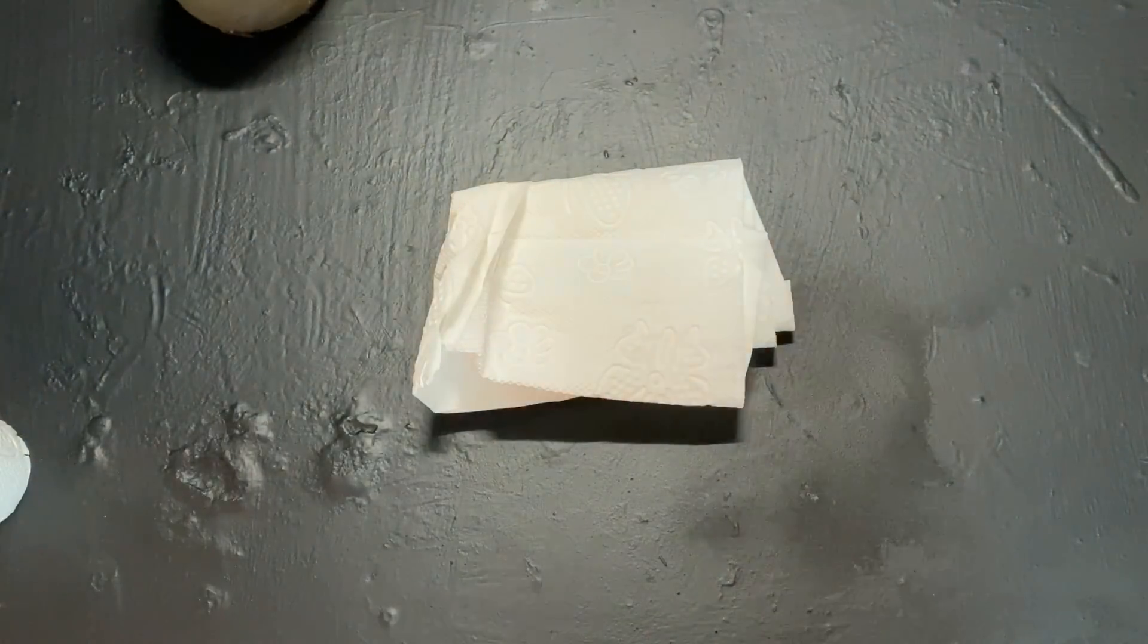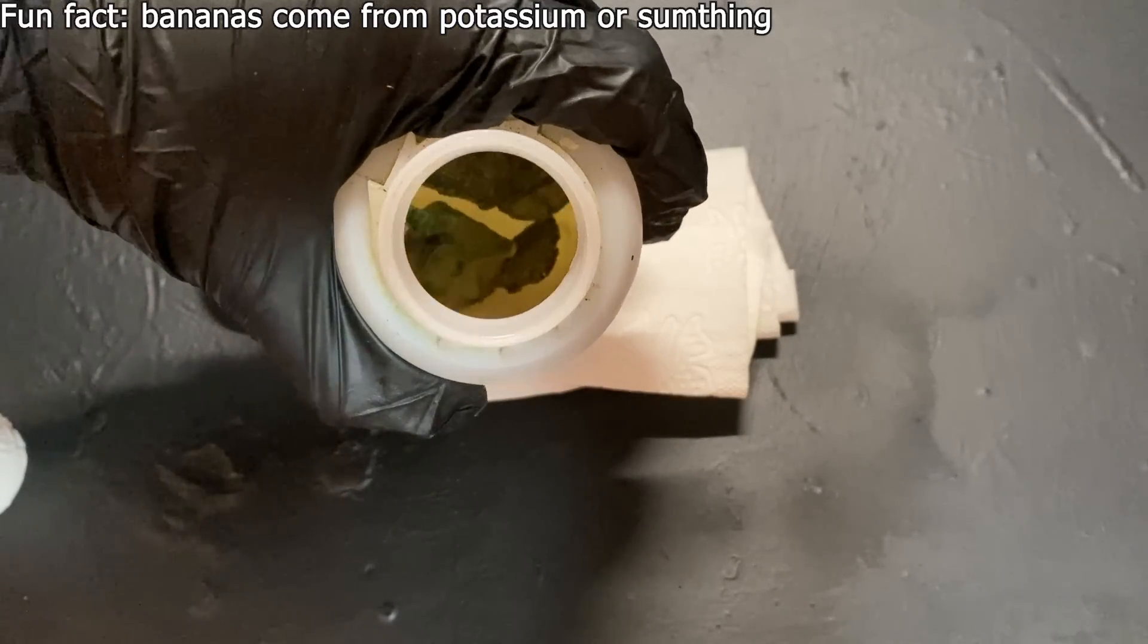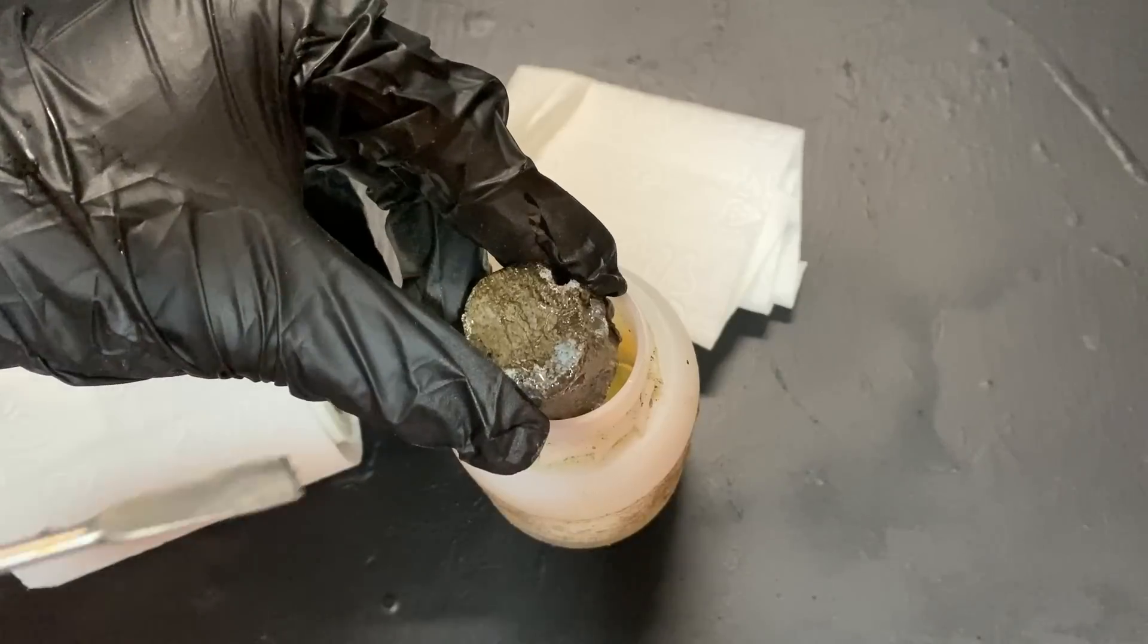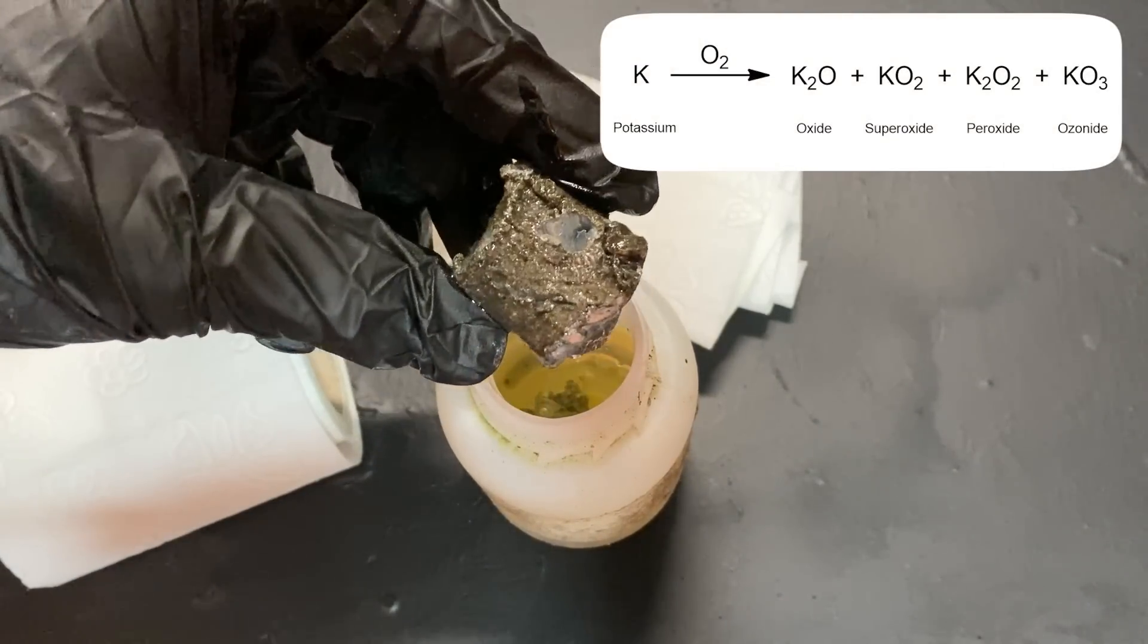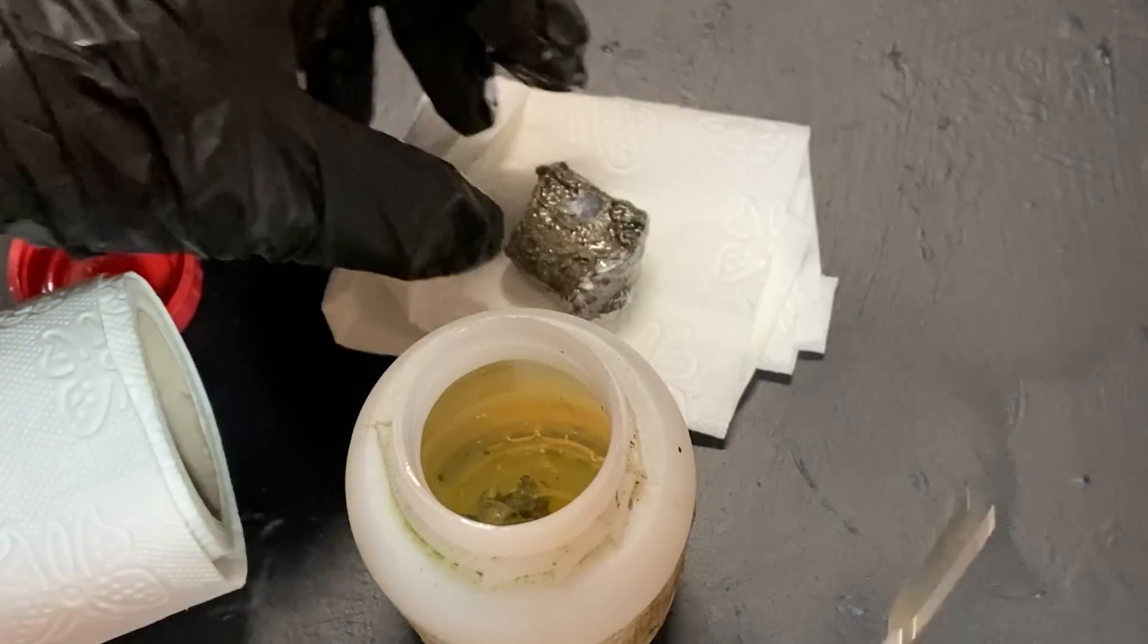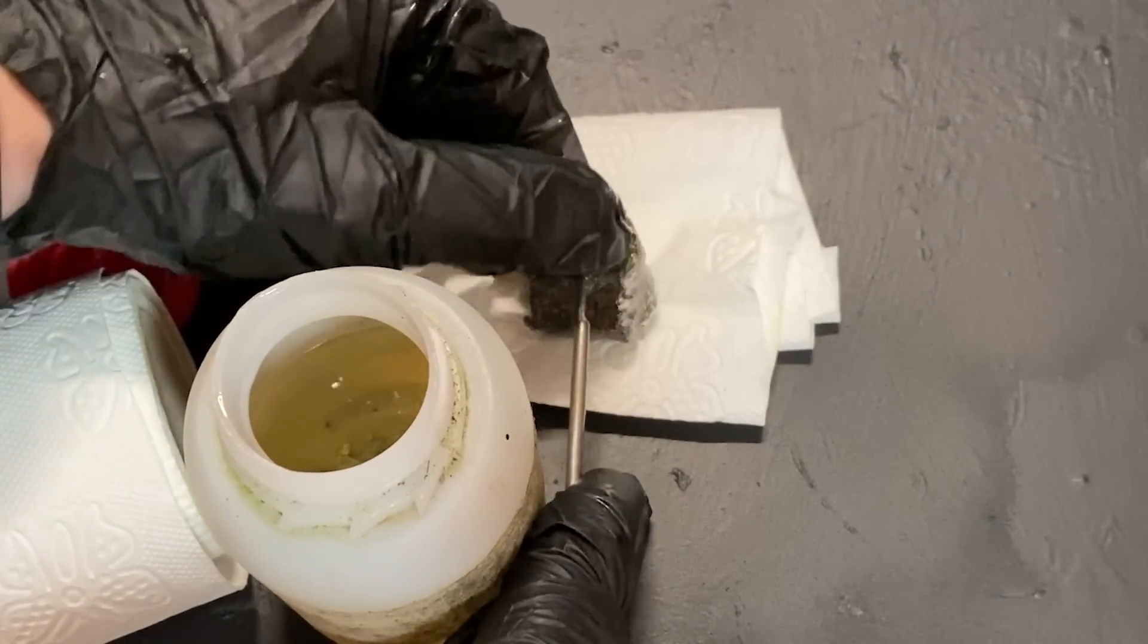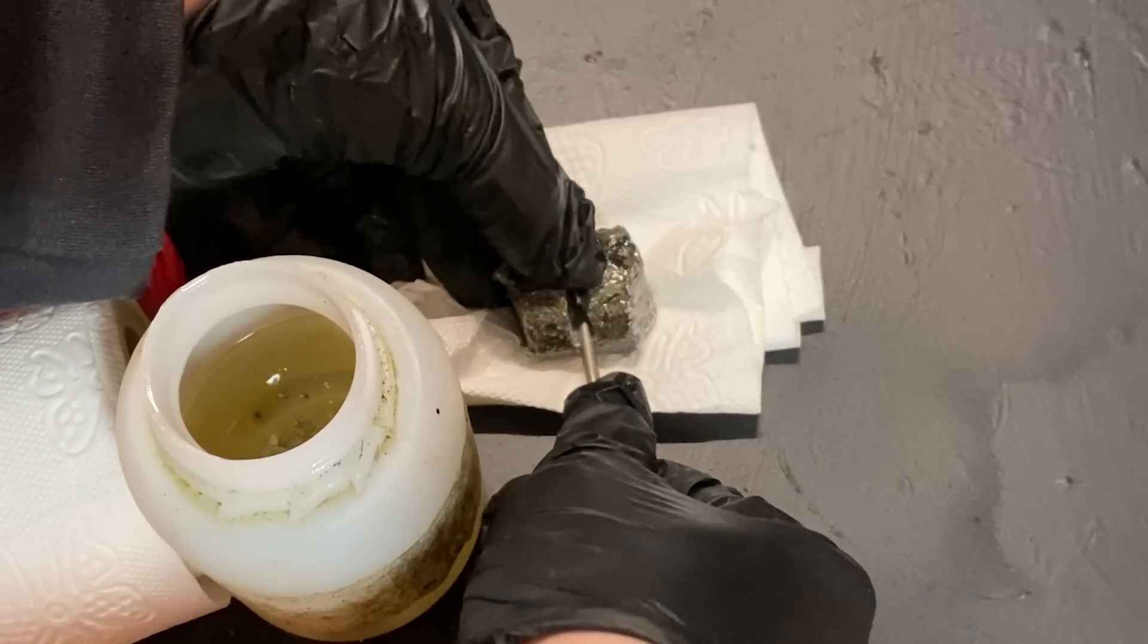First, though, I'll have to take out a piece of potassium, which to me is quite interesting by itself, because potassium is extremely rarely used. Pure potassium metal is shiny, but this one isn't because when exposed to oxygen in the atmosphere, potassium tarnishes to form oxides and superoxides of potassium. And even though this was stored in a closed bottle for almost all of its lifetime, some oxygen still manages to get in there. That's why when I cut it in half, you can see its shiny interior.